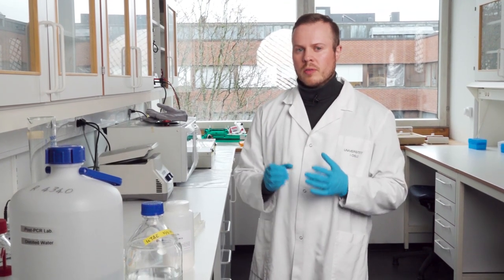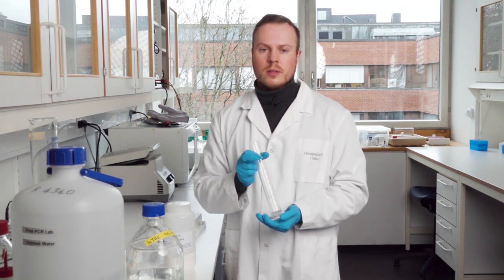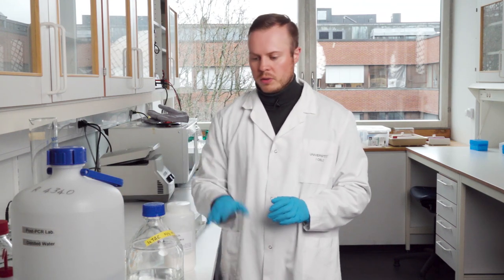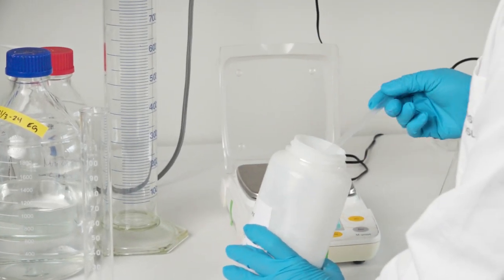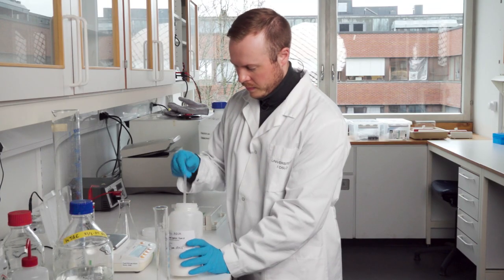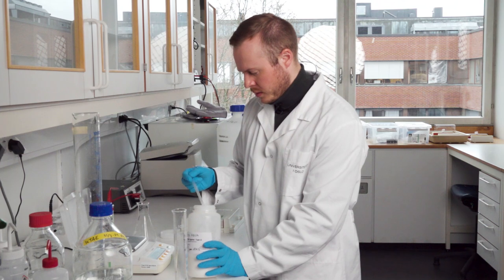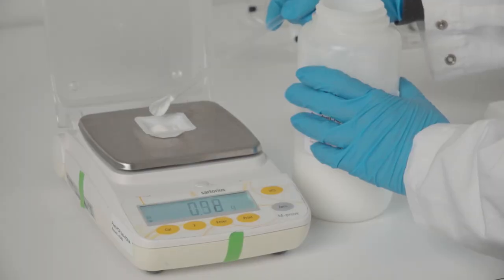The concentration of agarose powder affects the gel's capabilities, but for most circumstances, a 1% agarose gel is more than adequate. That means if we have 100 milliliters of TAE buffer, we need 1 gram of agarose powder. I use the spoon to add powder to the measuring tray. This was 0.40 grams, now 0.95, and there we have exactly 1 gram.